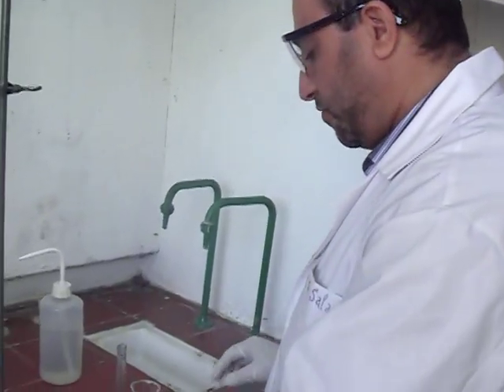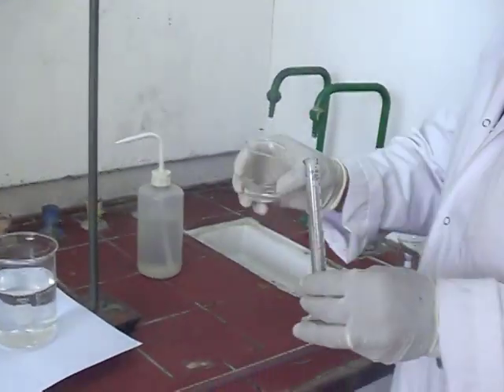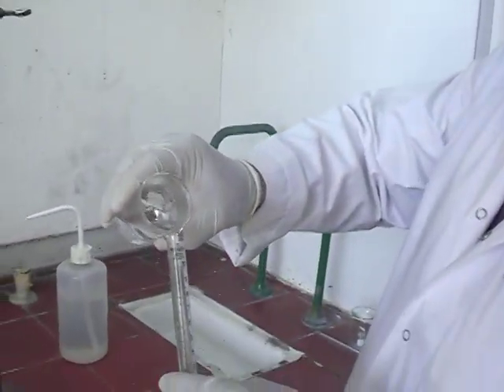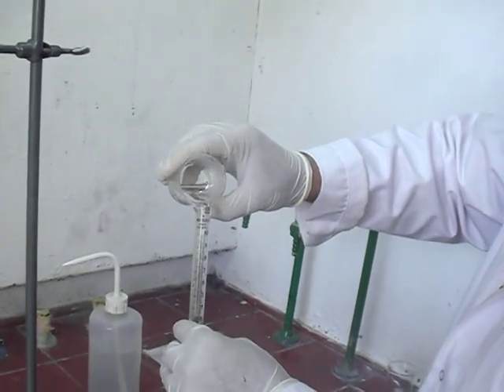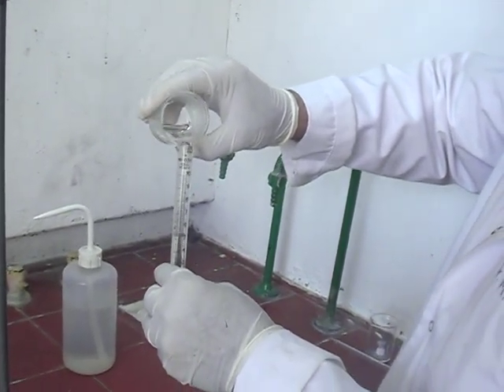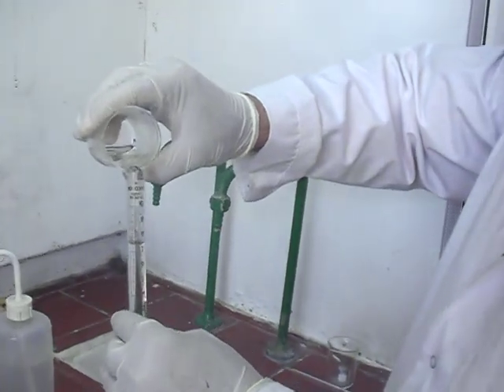For the second part, for the determination of the universal gas constant, using your glass cylinder measure 10 ml of the concentrated hydrochloric acid. Be careful with that - it's very corrosive acid and you have to handle that inside the fume hood.